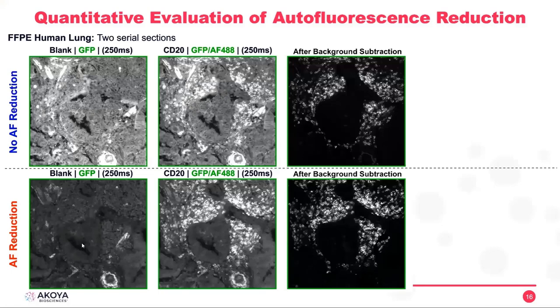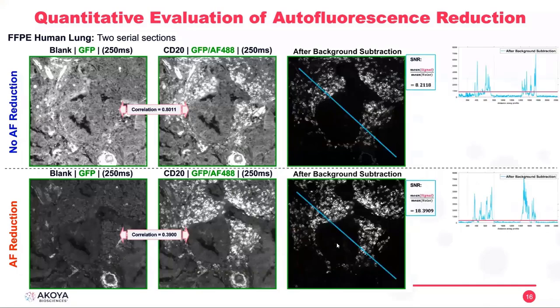And when we do autofluorescence reduction, we can see our background gets lower, but this time not completely. We still can see some background. If we calculate the correlation, it goes from 80% to 40%. So it lost half of the correlation. And we can see that our extracted image from the background subtraction looks like we have higher intensities for the CD20 for those B cells, and our signal to noise ratio doubled.